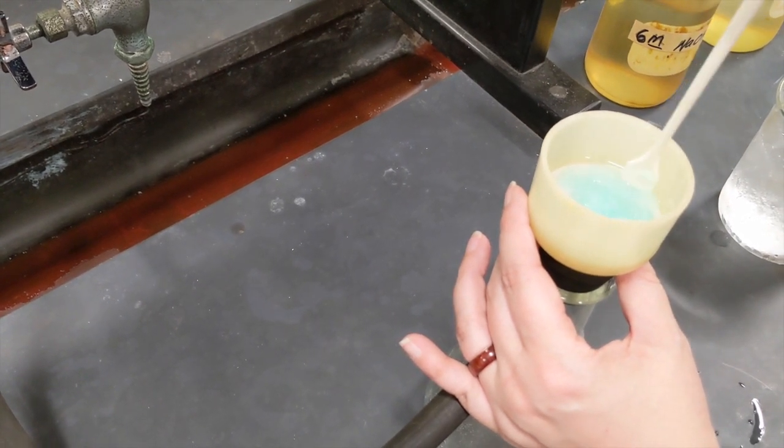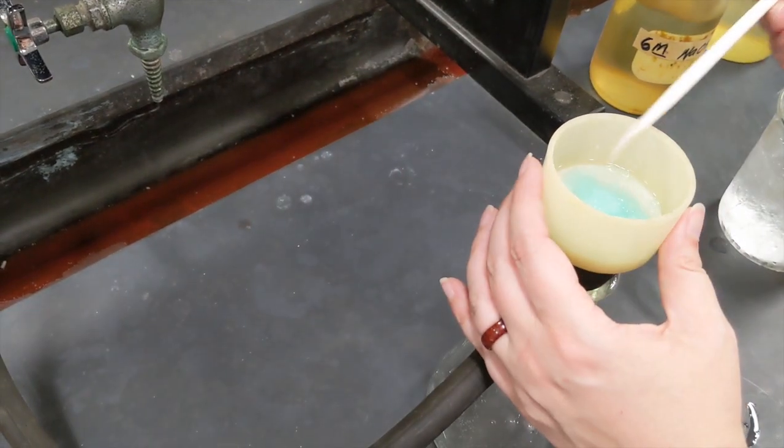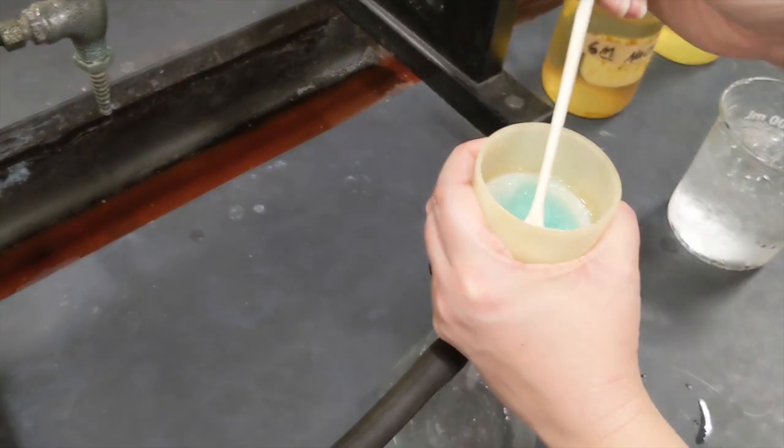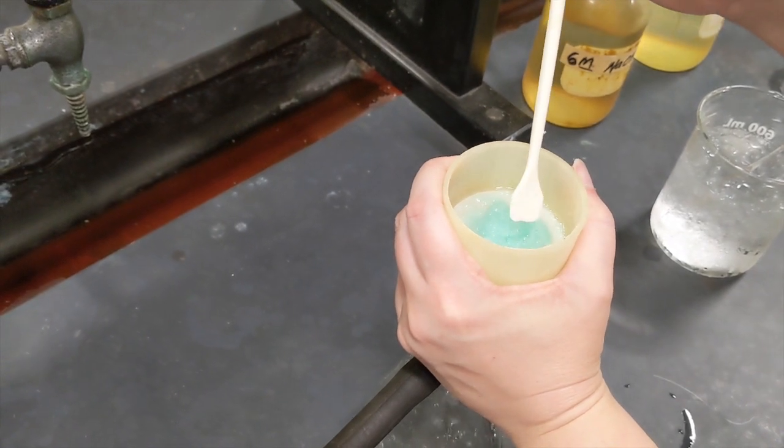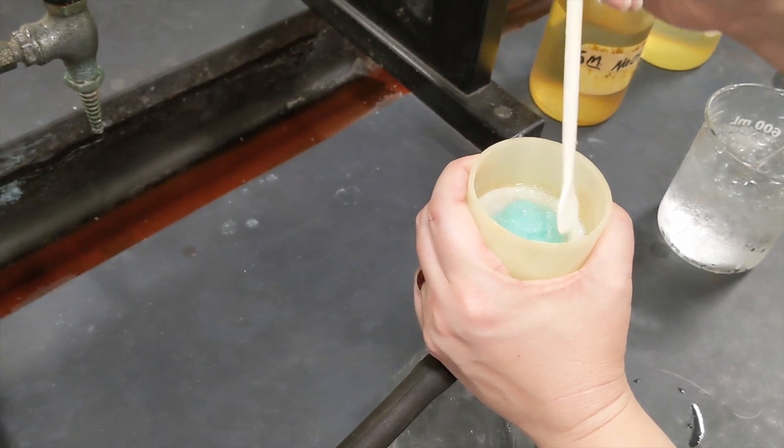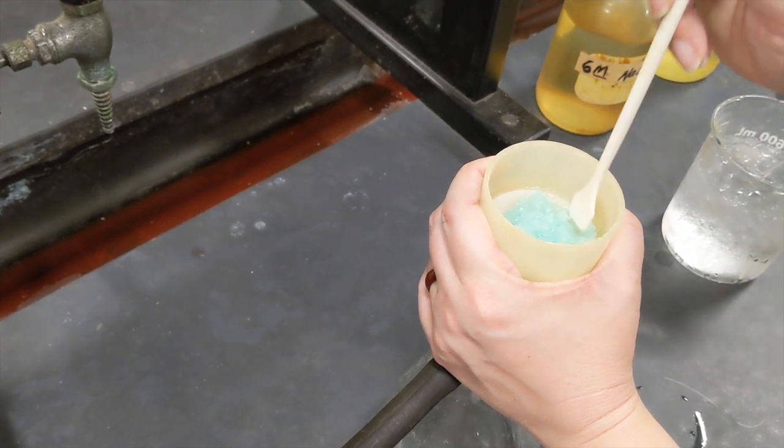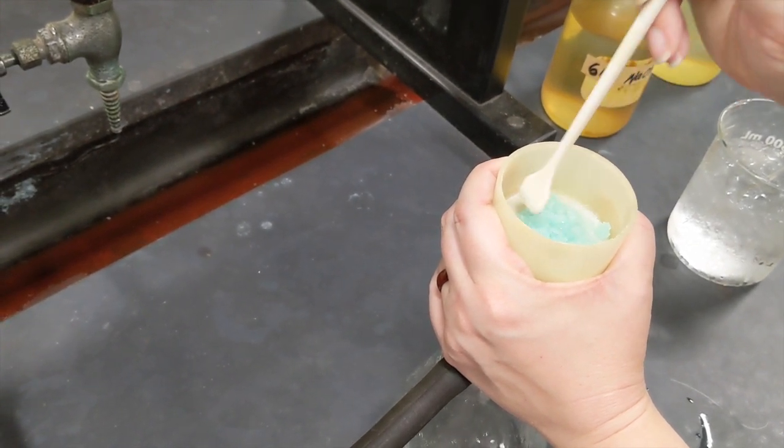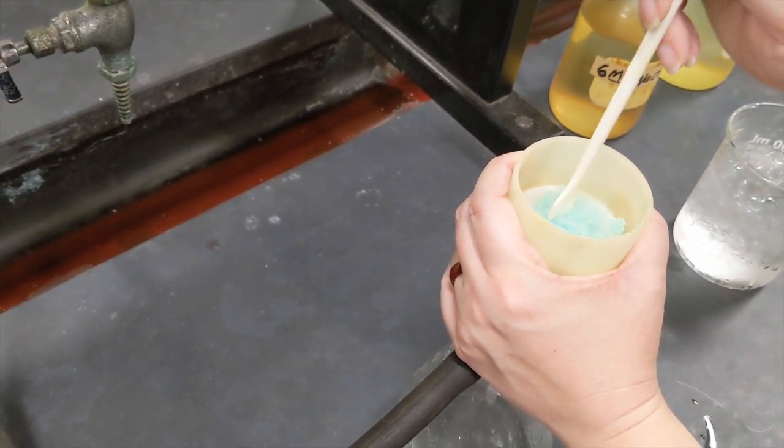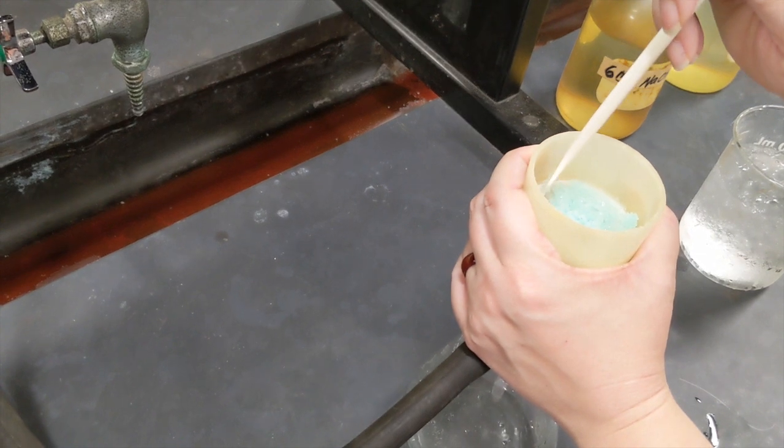Which will pull the ethanol through. I'm sort of chopping this up with the spatula a little bit to let any liquid that's on get pulled through more effectively.